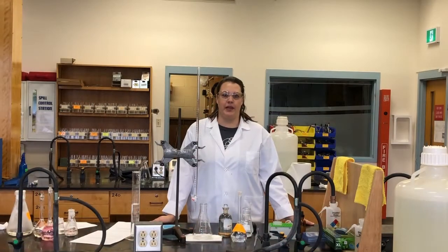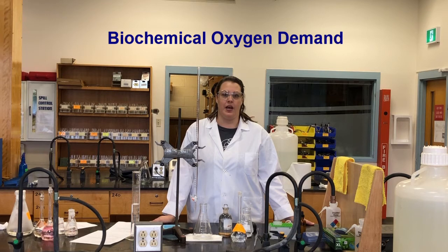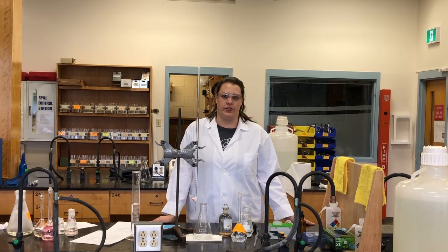Everyone. So we're back here now in the lab to look at biochemical oxygen demand, so BOD. This is actually going to be the exact same procedure that we did last week for dissolved oxygen. The only difference is our samples have been incubated now for 5 days.